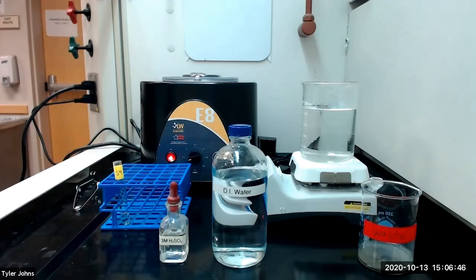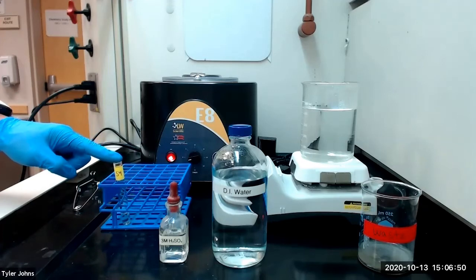We will now perform the test for tin ion. We will use solution S4, which we had previously set aside.